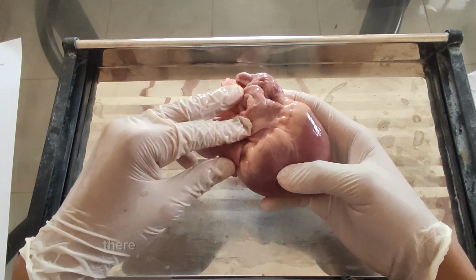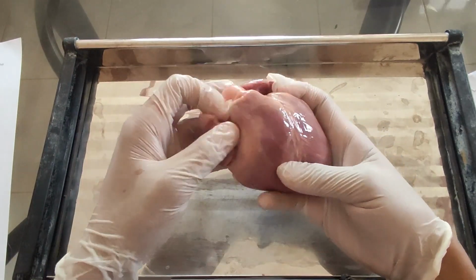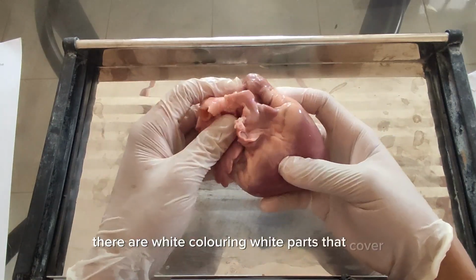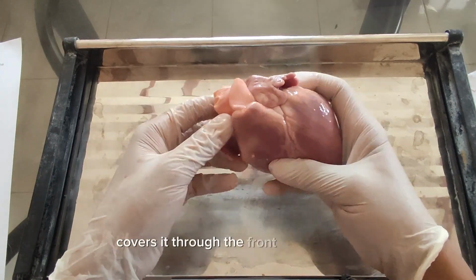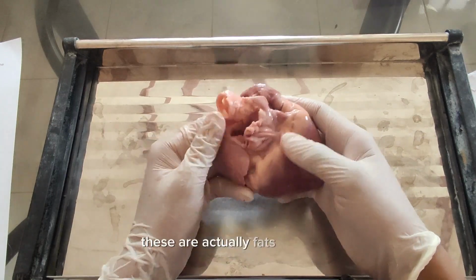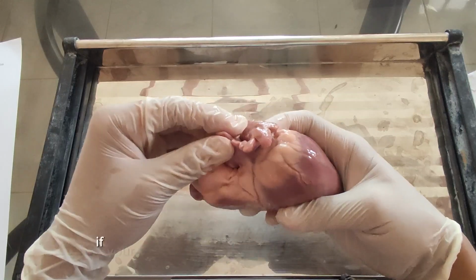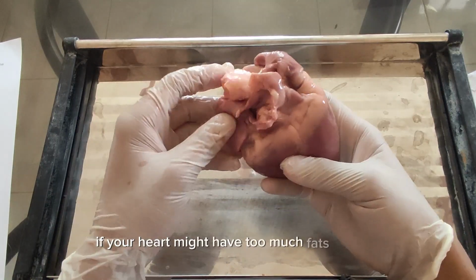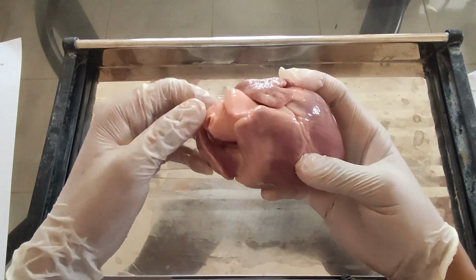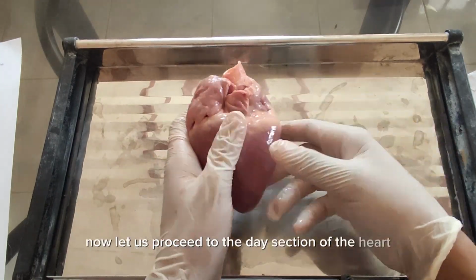As you can see here, there are white parts on the top of our heart, the upper portion, the superior part. There are white parts that cover it through the front and the back. As you can see, this white part is actually fat. So look out, because if your heart has too much fat close to it, control your diet, everyone. Now let us proceed to the dissection of the heart.